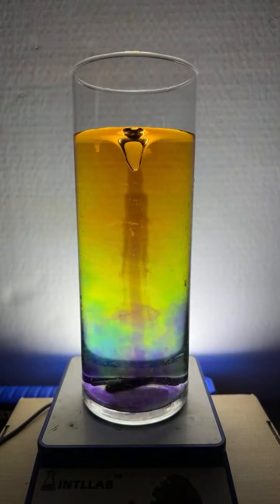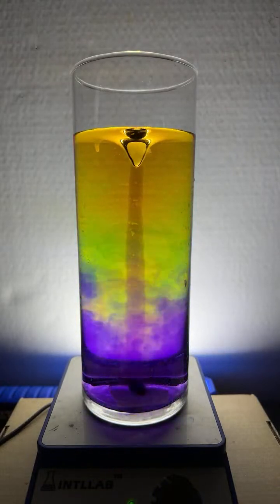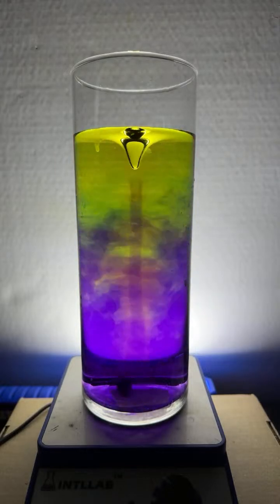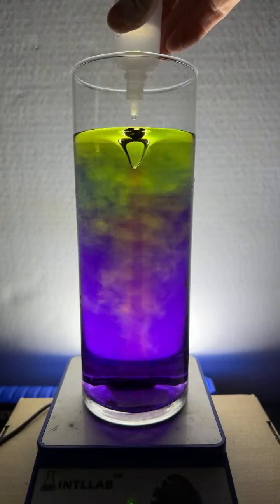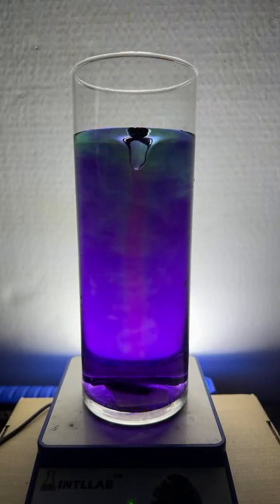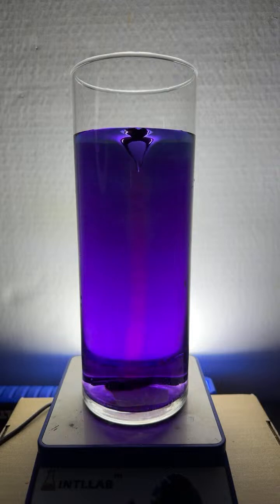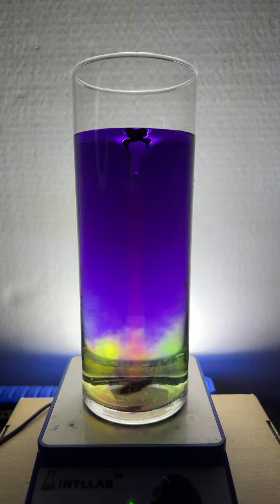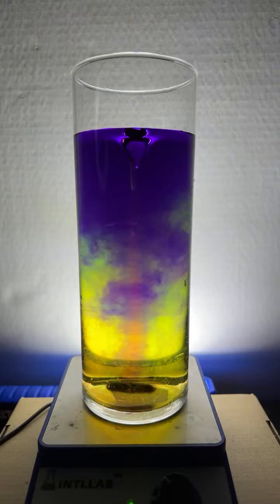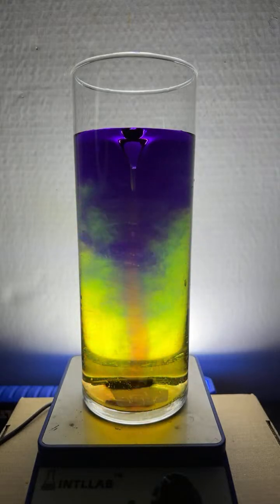Yeah, isn't that cool? You adding those different... Man, those flows are just really showing up nicely tonight. Really showing up pretty. Here's some acid I'm adding. The acid tends to shift us to a red, orange, or yellow color. There it is. And the base is what shifts it to the violet and the blues.